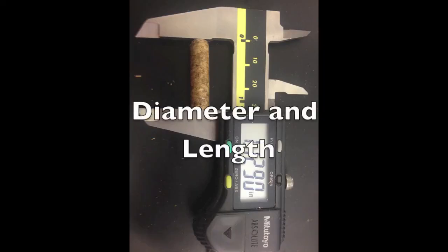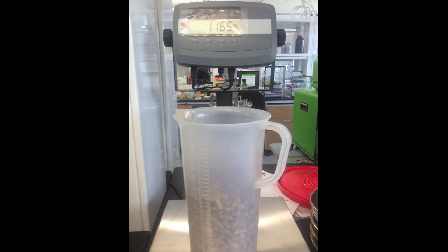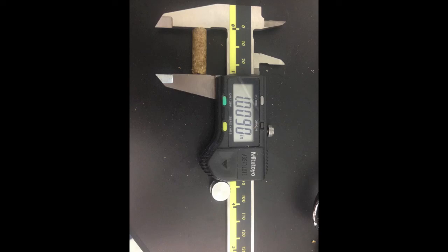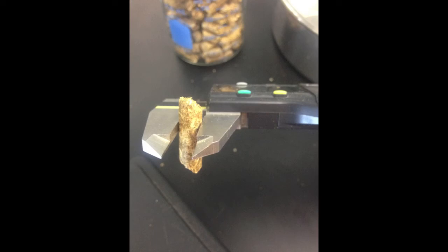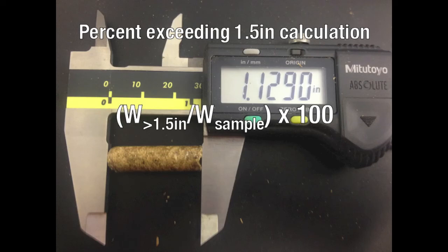Next, you will look at the diameter and length of pellets. First, obtain 2.5 pounds or 1.13 kilograms of your sample pellets and record the exact weight of the sample. Using a caliper, measure the pellets and separate pellets that are longer than 1.5 inches. Identify the longest pellet and measure its length using the caliper. Next, measure and record the weight of the pellets exceeding 1.5 inches. Lastly, select 5 random pellets and measure their diameter using the caliper and record the average. Calculate the percent of pellets exceeding 1.5 inches by taking the weight of pellets exceeding 1.5 inches, dividing by the sample weight, and multiplying by 100.